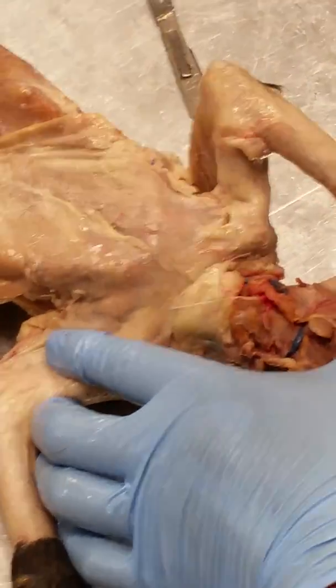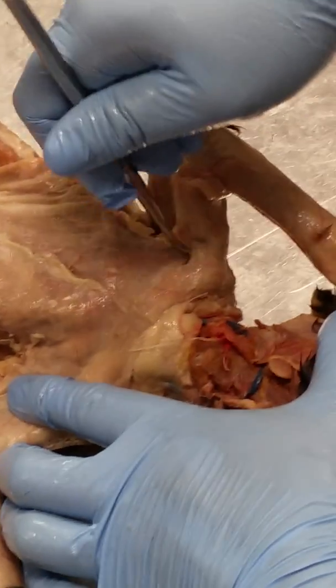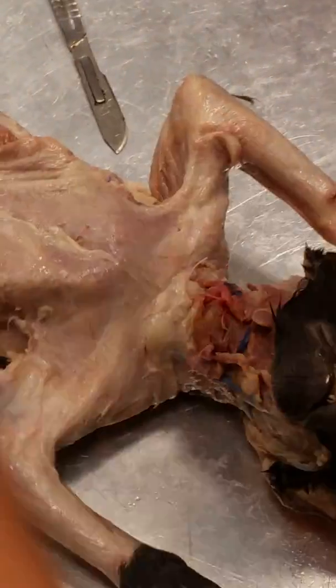What's that? Pectoantebrachialis. Pectoantebrachialis. Beyonce. Oh yeah. I was about to say the sprinkler thing. No, that's like this. Okay.